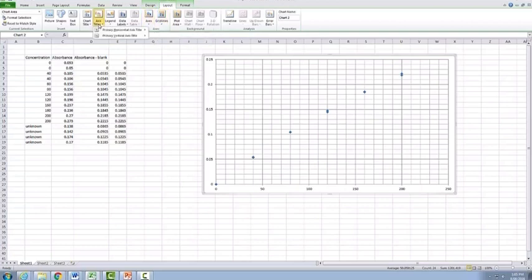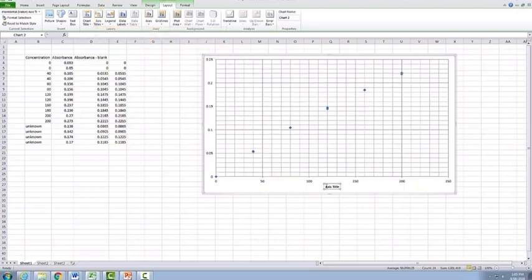The next thing we need to do is label our axes. So we go to horizontal axis and we put the title below the axis, and this one here, because it's our concentration and it happens to be concentration of protein, so it's going to be concentration of protein, and in this particular case it's actually in micrograms per mil. So always make sure when you're labeling your x-axis, you tell us what the concentration is of, whether it be a protein or specifically a sugar, reducing sugar, or a particular protein. In the case of the first years, you guys would be writing concentration of albumin. And then you also need to always make sure you include the units as well. And then you can press enter and you can see that the title is added down the bottom here.